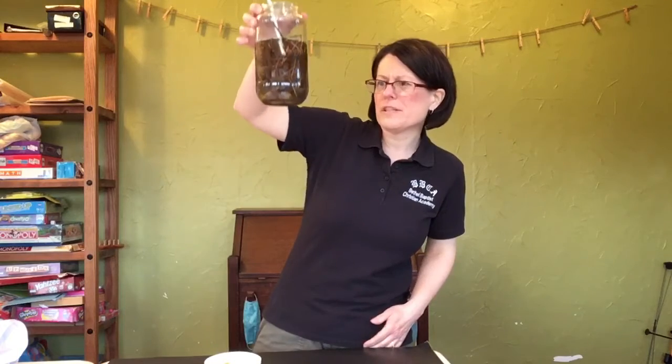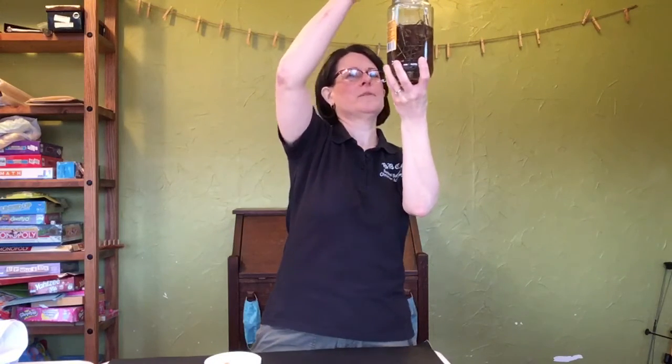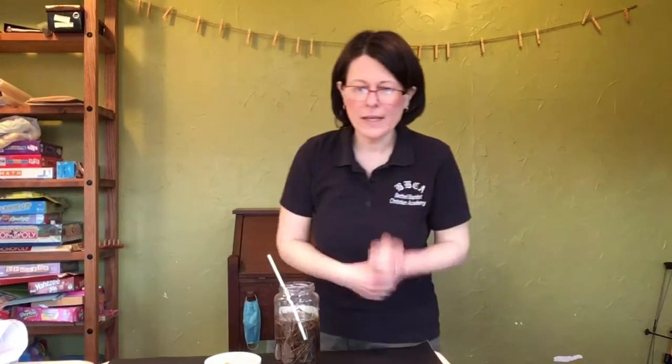It also says to record the turbidity — that's the cloudiness of the water. Indicate not only how cloudy the water is, but also what color it is. My water today has very little turbidity, but it is kind of a yellowish color. I stirred it up a little, which is what I'm not supposed to do, but before that there was very little turbidity. I'll record 'little turbidity, yellowish color.'